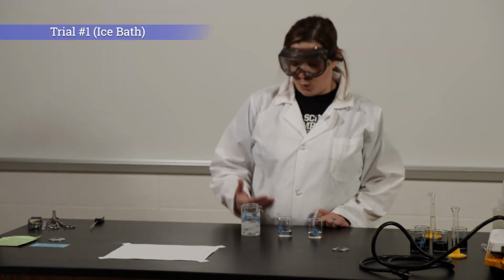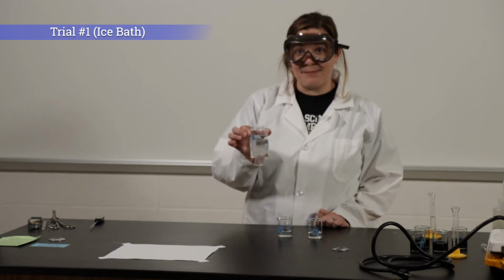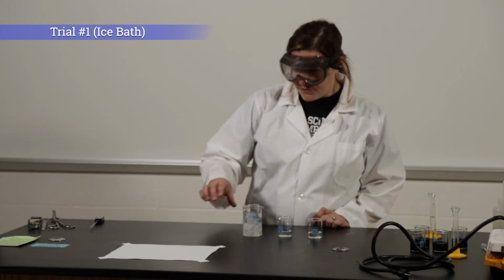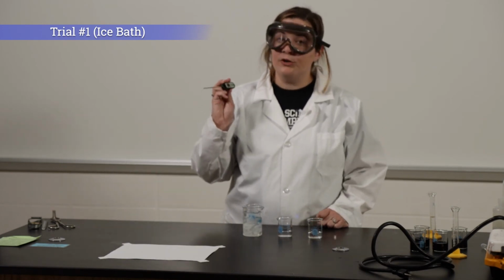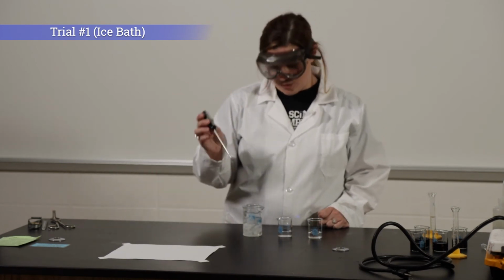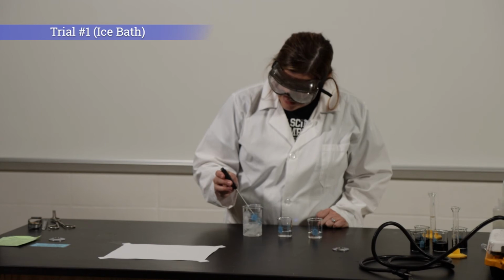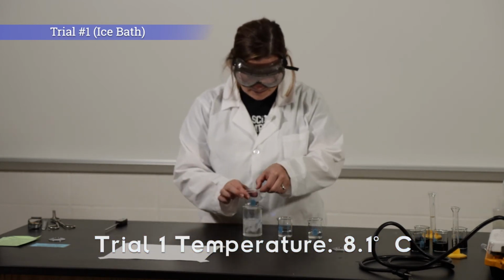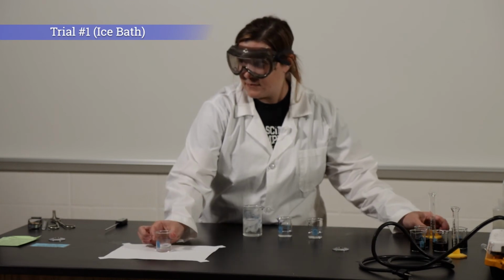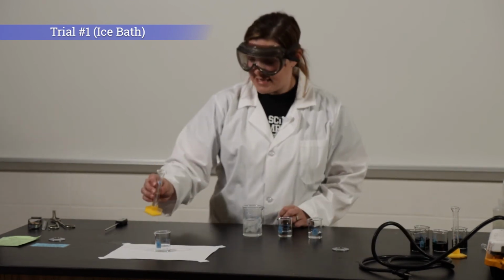For trial number 1, I have my beaker in an ice bath. So the first thing that I'm going to do is record the temperature. You're going to need to record this temperature in your data table. The temperature of solution A is 8.1 degrees Celsius. Now I'm going to add solution B, and we'll record the time that it takes to turn dark blue.